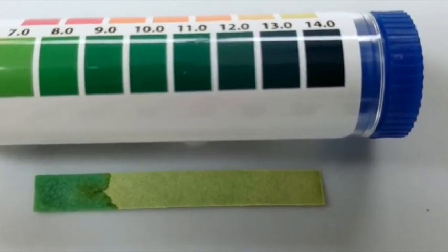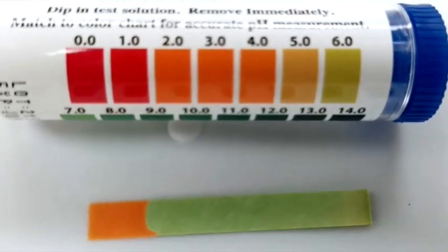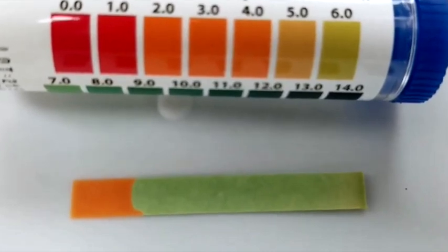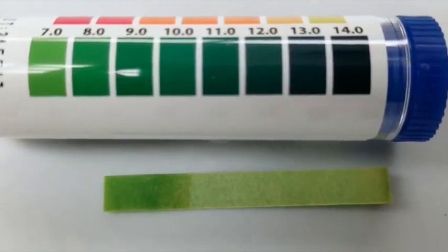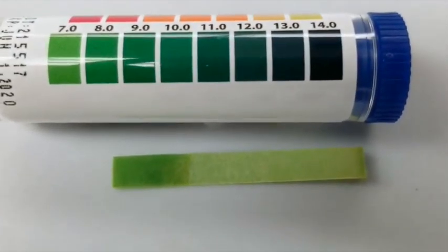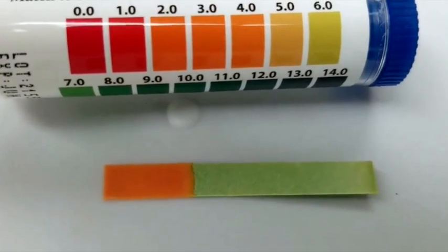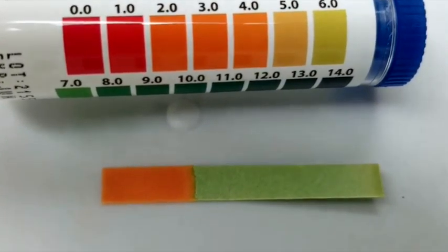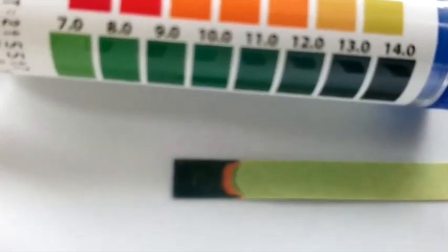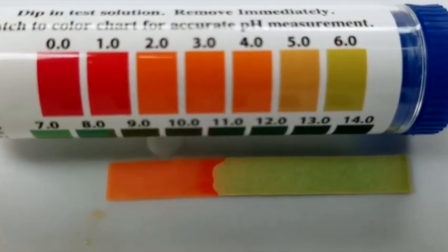In the next few seconds of this video, you will be shown the color of the pH paper as it is dipped into various solutions. Record your observations and approximate the pH based on the color of the pH paper. Use your observations to complete the rest of the post lab and turn it in.